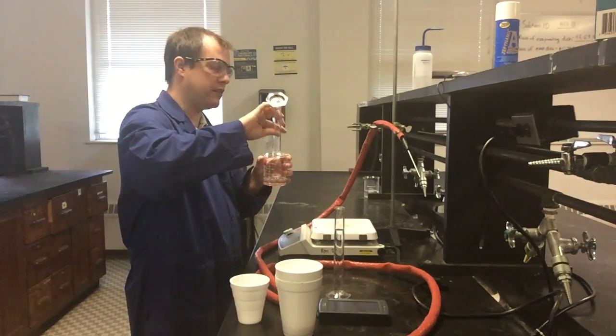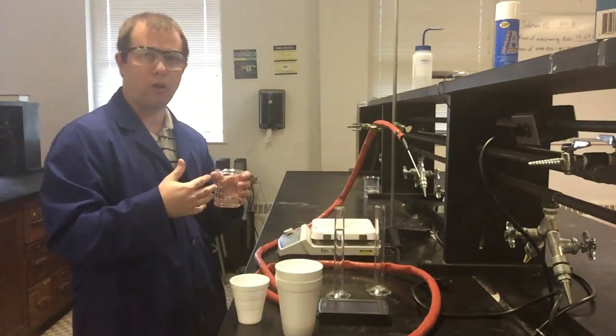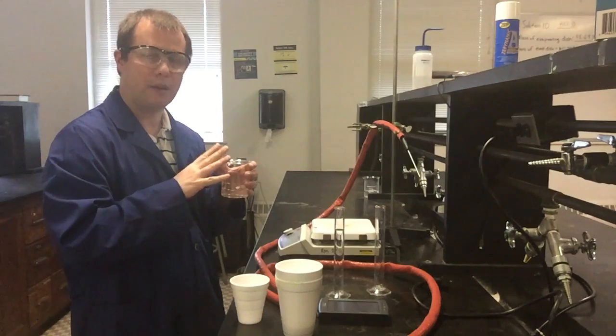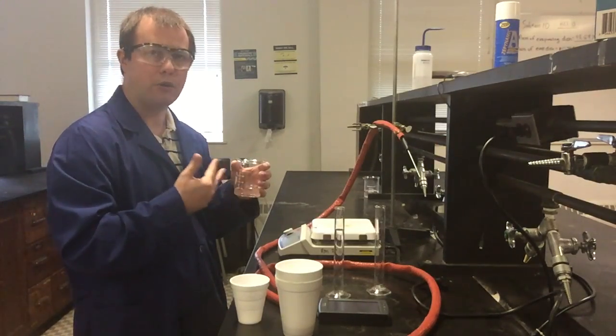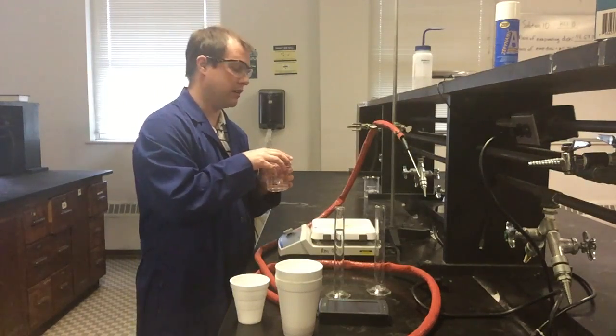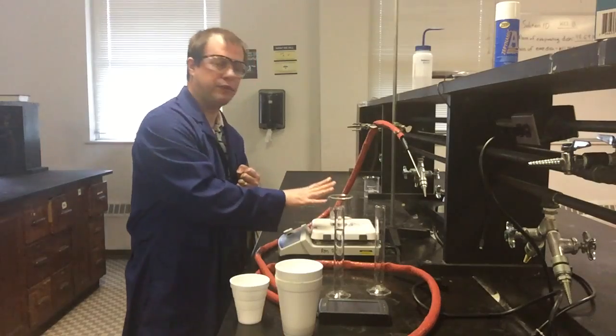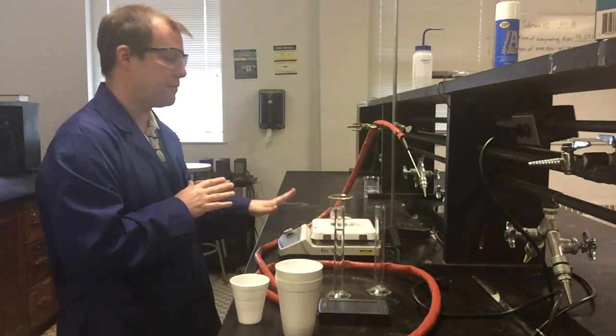It's important that I do have that exact measurement because that is something that's going to influence the mass of water. Because if we're doing temperature changes and looking at heat, Q equals MC delta T being our equation, we do want to know the mass as accurately as we can. So I'm going to go ahead and take that 50 milliliters of water and heat it up. I'm going to heat it up on a hot plate.